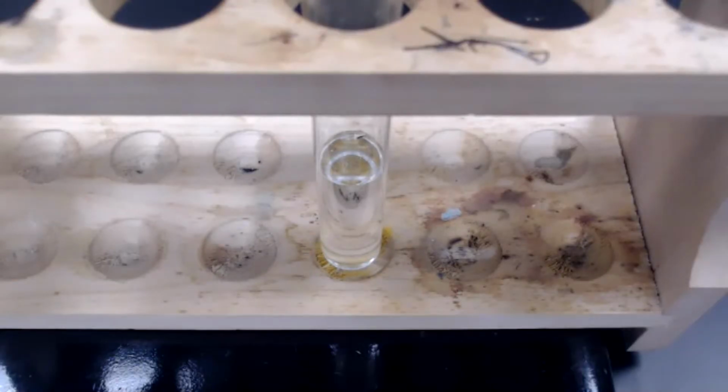So you can better see what happens when a precipitate forms, I'm going to repeat that step. This time, my sodium chloride solution has been transferred to a test tube, and once again, I will add silver nitrate to the top so that you can see what precipitation formation looks like. Notice the white solid that has formed at the top of the test tube.